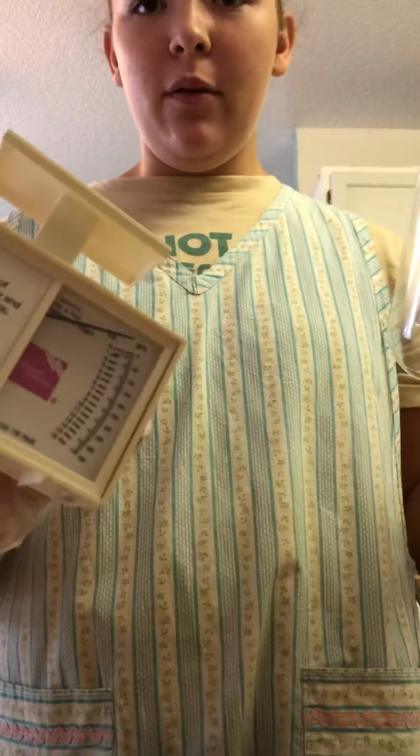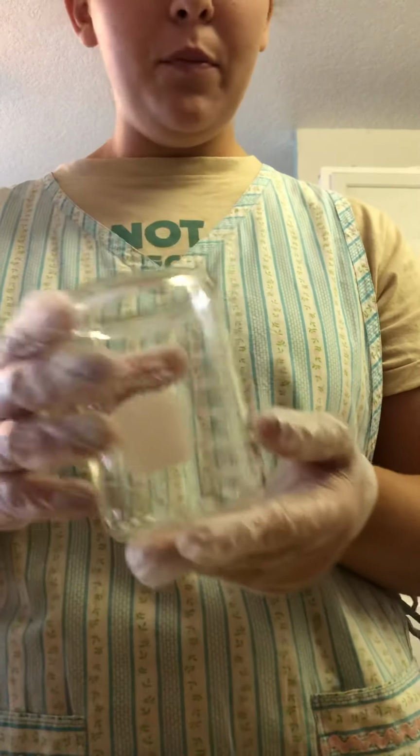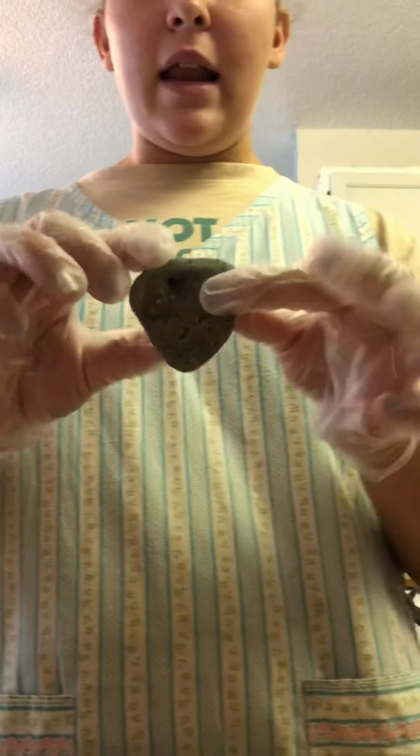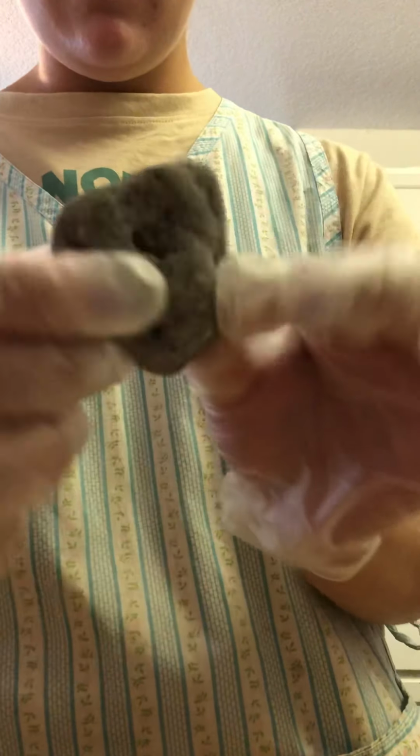The materials I will be using are a weigh scale. It is not digital, as you can see, but the increments go up in measures of 50, and each of the small tick marks represents 12.5 grams. There's a weigh boat that accompanies the scale. I have a 400 milliliter beaker to find volume. I have a liquid measuring cup to pour water into it. And then I have an irregularly shaped stone.